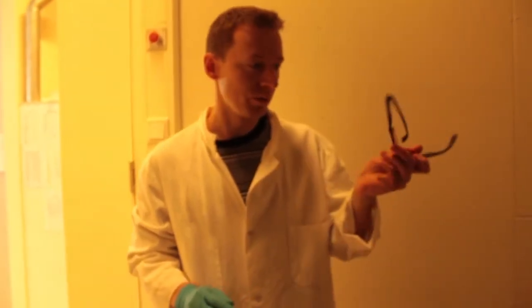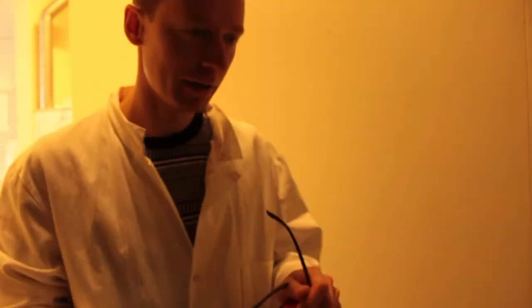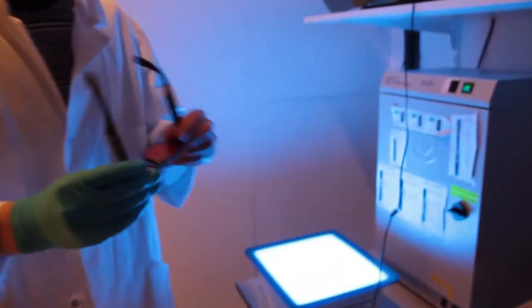To do this we need to wear these glasses and the reason why is because when we turn on this blue light and put these glasses in front of it, you can see the blue light disappears. I'm going to try to make it a bit darker as well and put this thing all the way here.